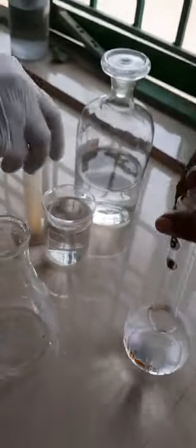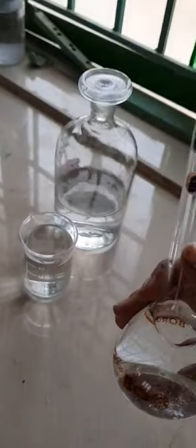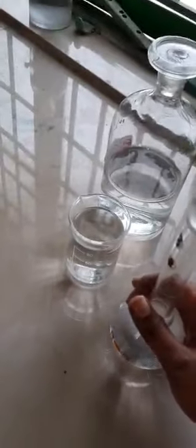So I have taken around 10 ml from the glycine stock solution and made up to 100 ml using the same volumetric standard flask with distilled water. Fine. From this you need to take around 10 ml and add half a test tube of neutral formaldehyde. Since it is already done, your working solution is ready. Since COVID conditions, again we are going to take it in the measuring cylinder. But in your examinations, the volume given in a standard flask may vary, each candidate will be given a different volume, but you need to make up to 100 ml itself.